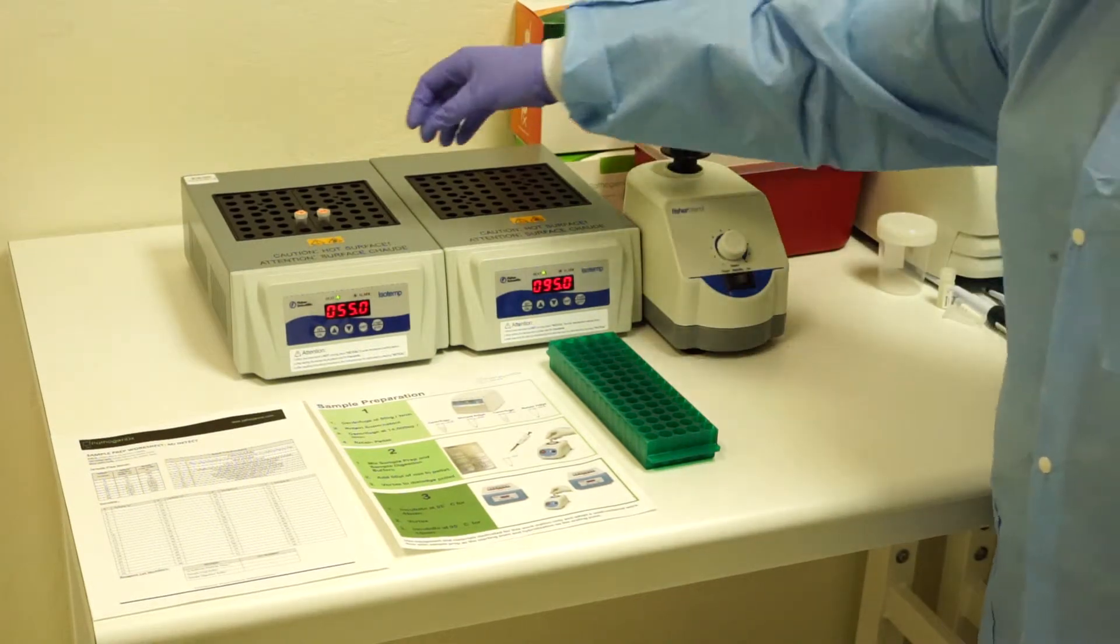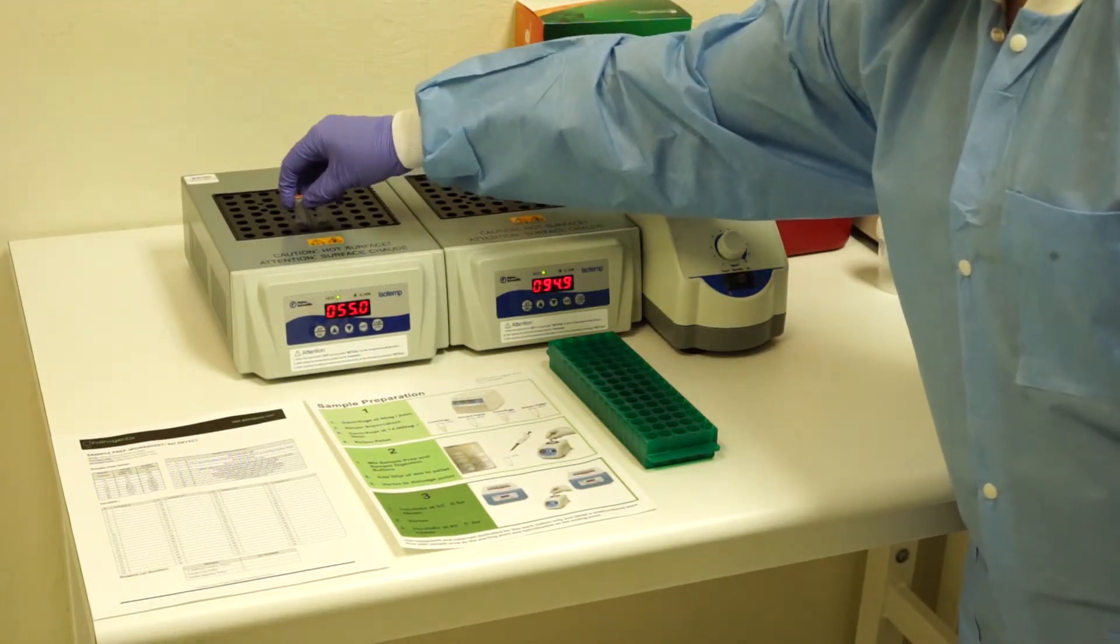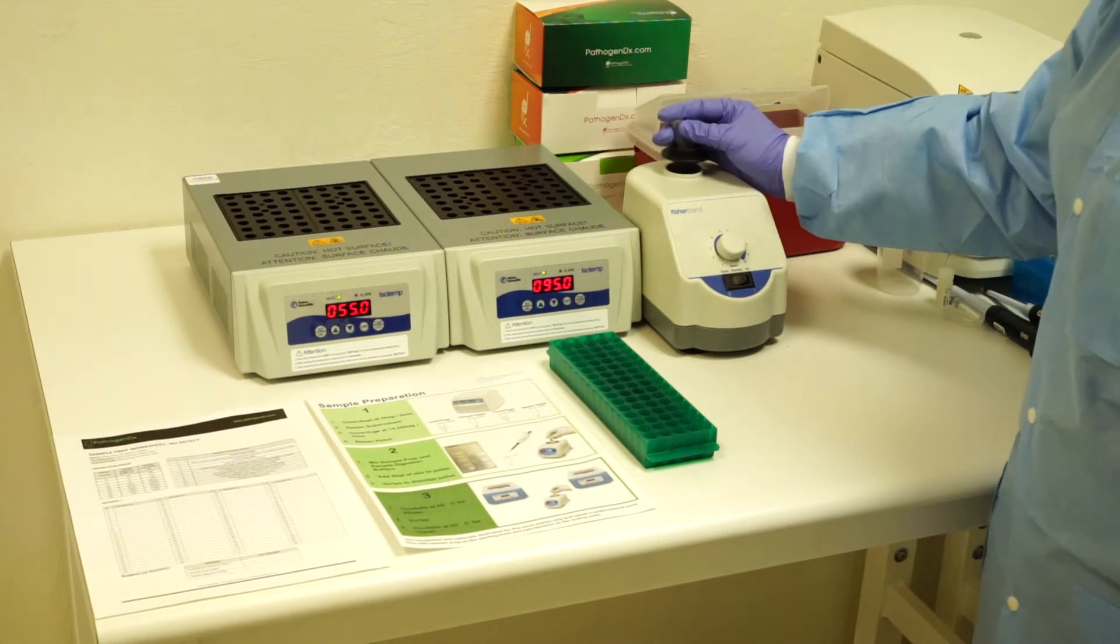Once the 45 minutes is completed at 55 degrees, the samples should be vortexed for an additional 10 seconds.